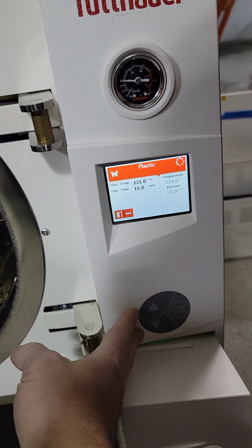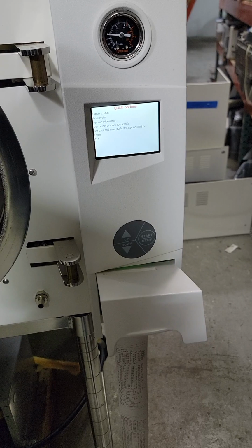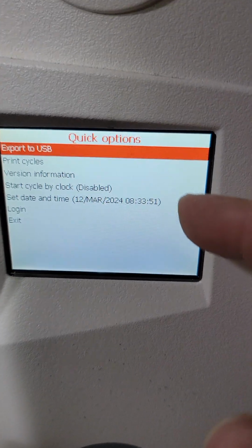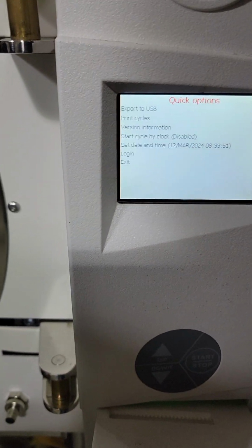Menu. Hold the up and down buttons at the same time for a couple seconds. There we go, there's the menu. Export USB. Print cycles in case you need to reprint stuff. Software version information, date and time, all that good stuff. Also a login feature to run other tests.